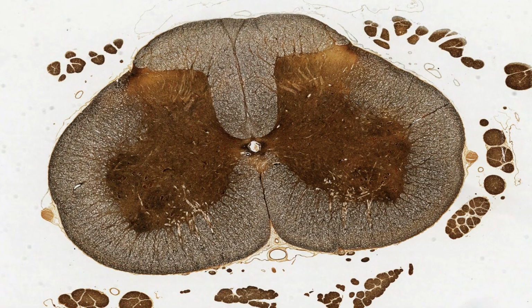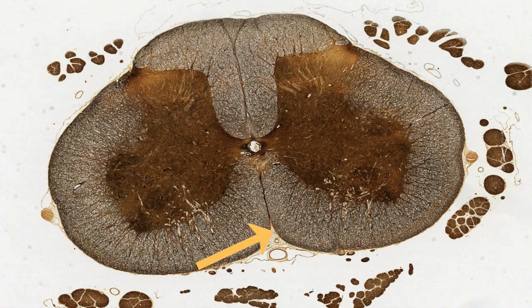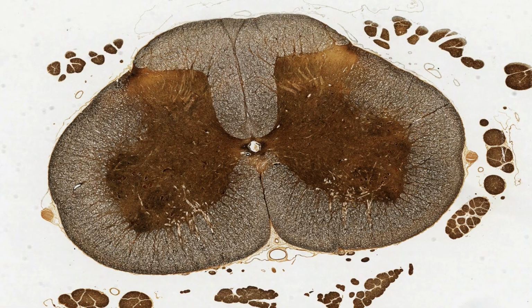Here is a cross-section of the spinal cord that has been stained with two silver procedures. Just as a review exercise, can you immediately identify white matter and grey matter, the ventral horn and dorsal horn? And here is the anterior or ventral median fissure. Look at all the brown stained nerve fibres extending between the grey and white matter. And out here are sections through nerve rootlets.